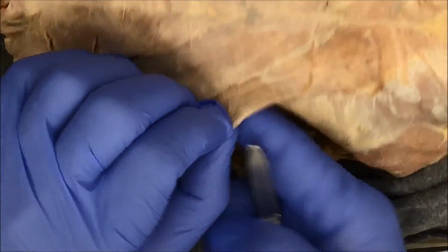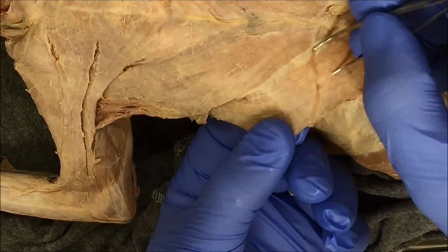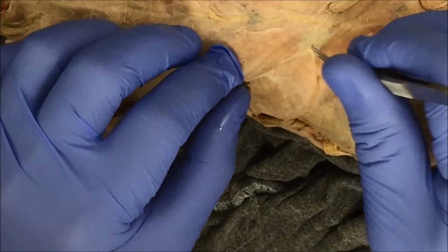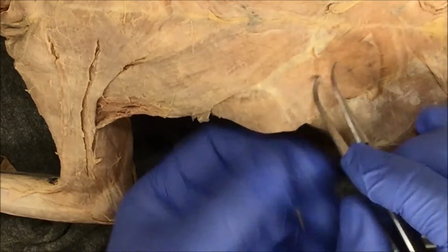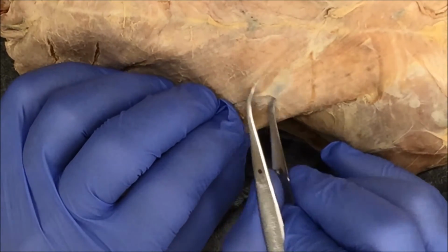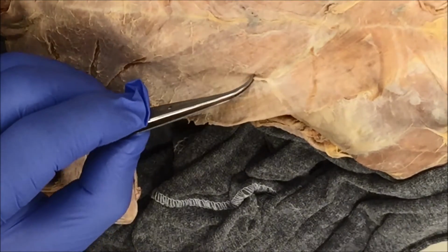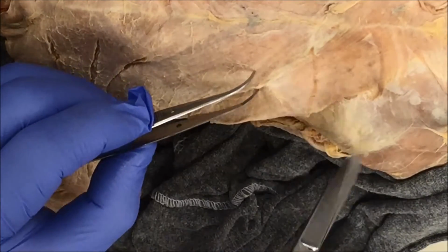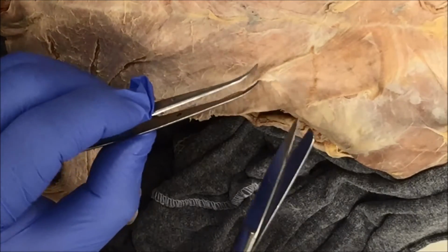And it goes all the way underneath, right? So now I'm just going to have to dissect this part right here, this connective tissue, which should be relatively simple. If I just lift up on the pec minor, I can do it. Or if I just go like I've been doing, lift the connective tissue and lift up, and then use my scissors, right, to cut. Just carefully cut that connective tissue.